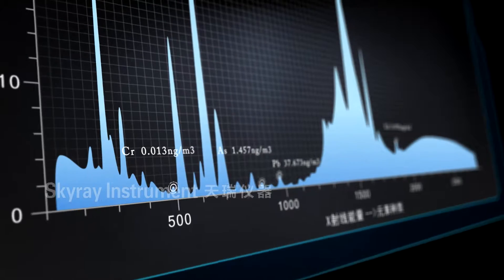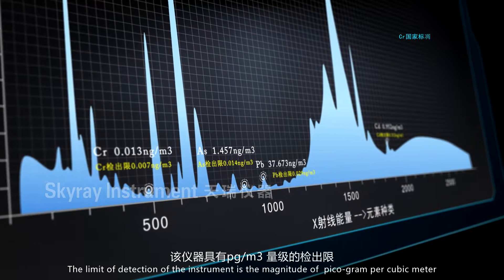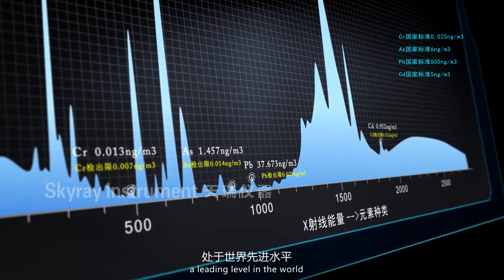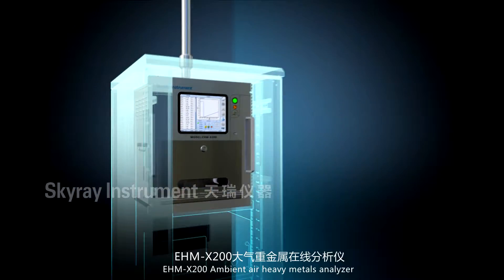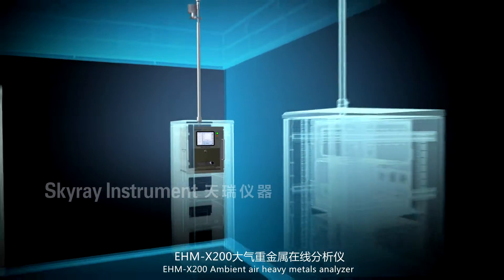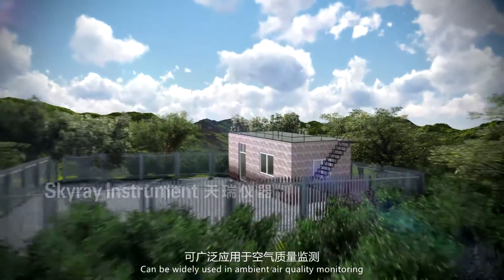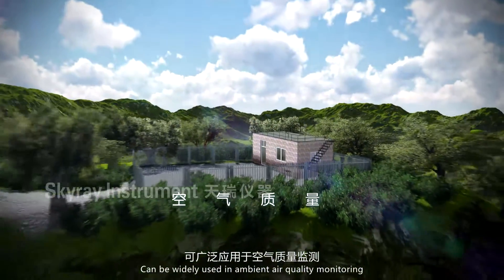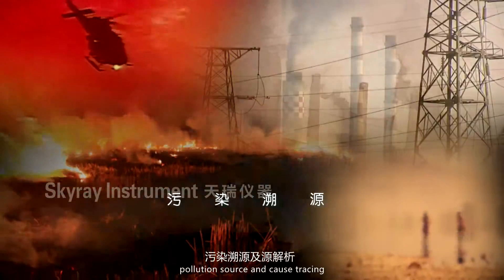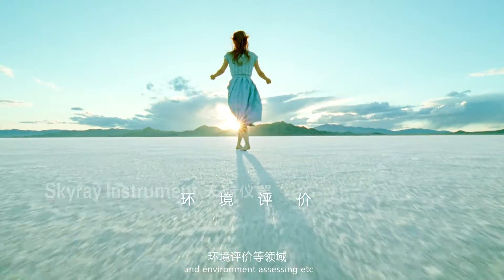The limit of detection of the instrument is the magnitude of picogram per cubic meter, a leading level in the world. The EHM-X200 Ambient Air Heavy Metals Analyzer can be widely used in ambient air quality monitoring, pollution source and cause tracing, and environment assessing, etc.